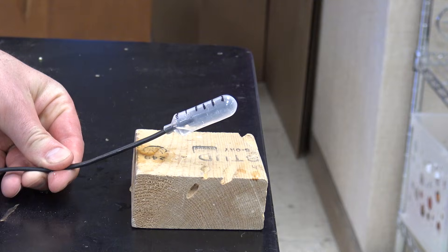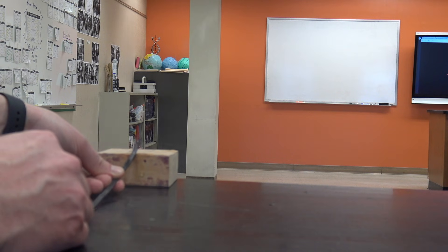But I'm going to do it a little bit different than you might expect. We're going to make little tiny rockets that we can launch in the lab out of these pipettes. We're going to have some chemical reactions, we're going to make some fuel, and we're going to launch these bad boys right across the room.